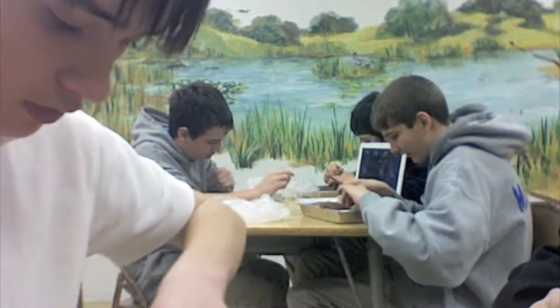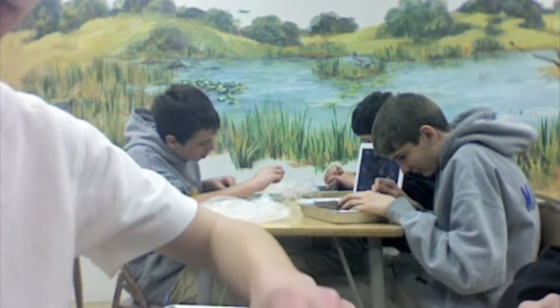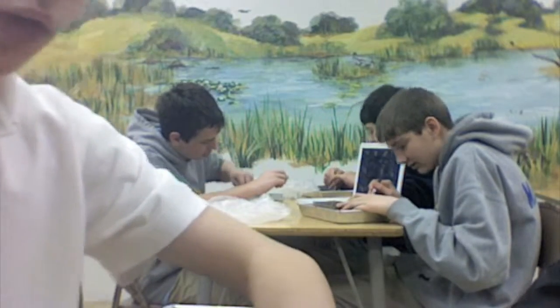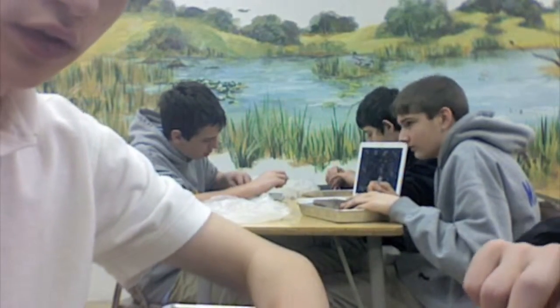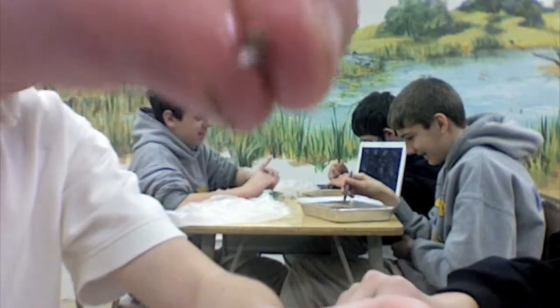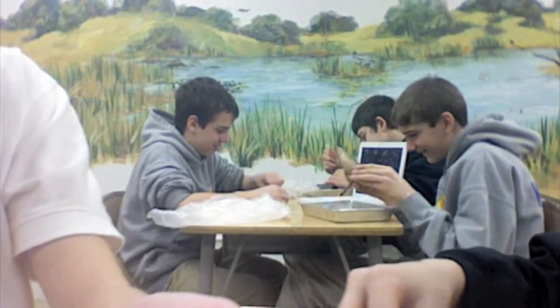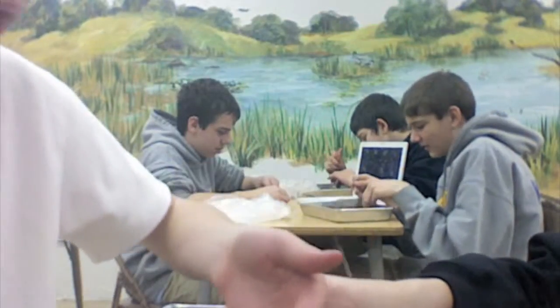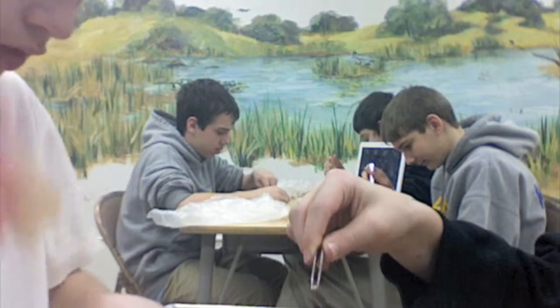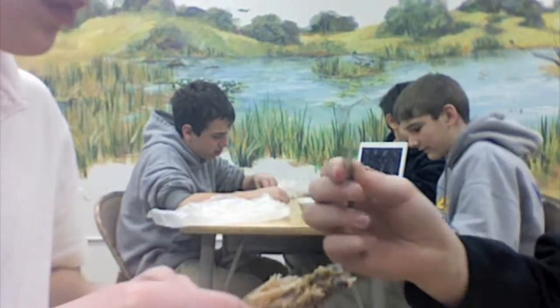I ripped up my fish's skull in half — there's one half. I'll show you the other one. I'm smart. It can open its mouth at a 180-degree angle, and I recorded this multiple times. That's the heart part of it. Here's the other one — didn't really show up. There's a better picture. That's a horrible cut rib cage. I should have done it on the other side.